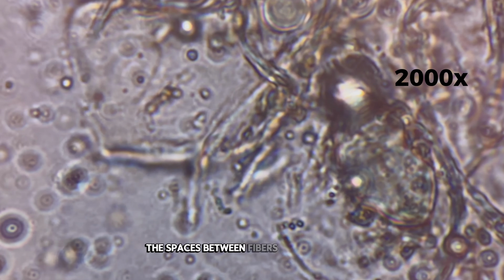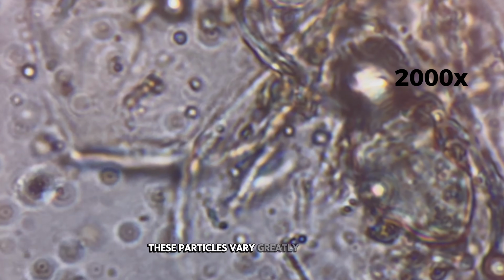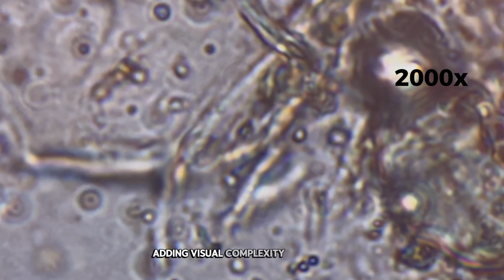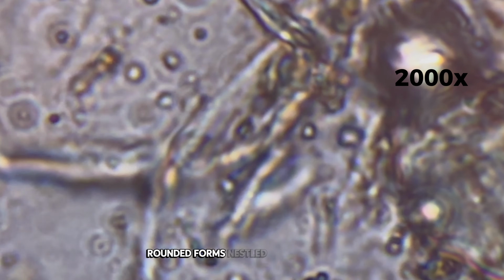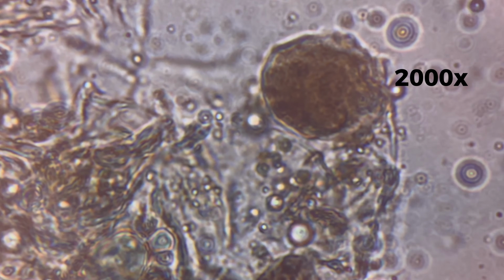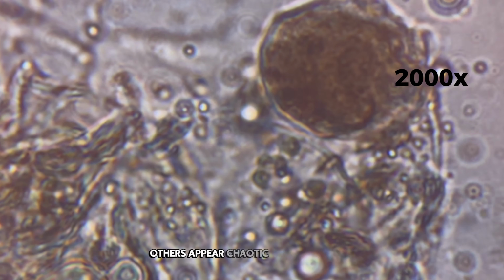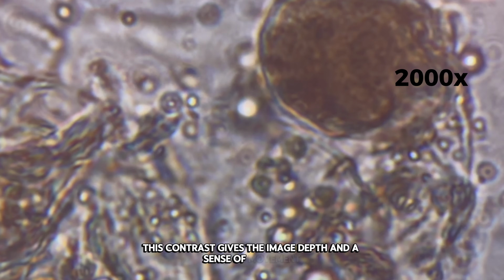The spaces between fibers are filled with countless microscopic particles. These particles vary greatly in size and shape. Some are round and smooth. Others are angular or uneven, adding visual complexity to the scene. Oil-rich structures appear as smooth, rounded forms nestled among the fibers. They follow the contours of the surrounding tissue, creating repeating patterns across the image. Some regions look highly organized and layered. Others appear chaotic and fragmented. This contrast gives the image depth and a sense of movement.